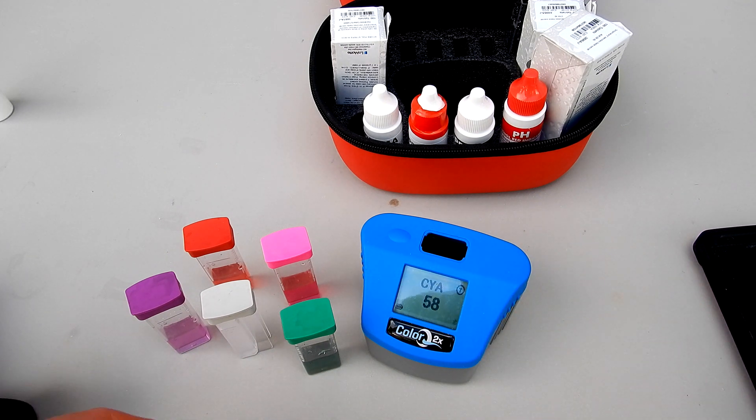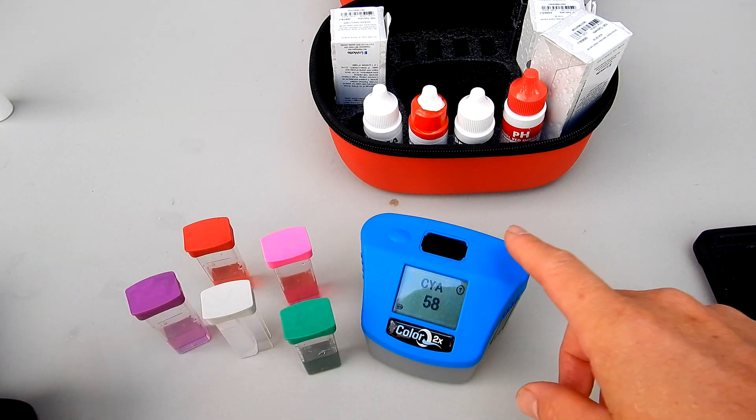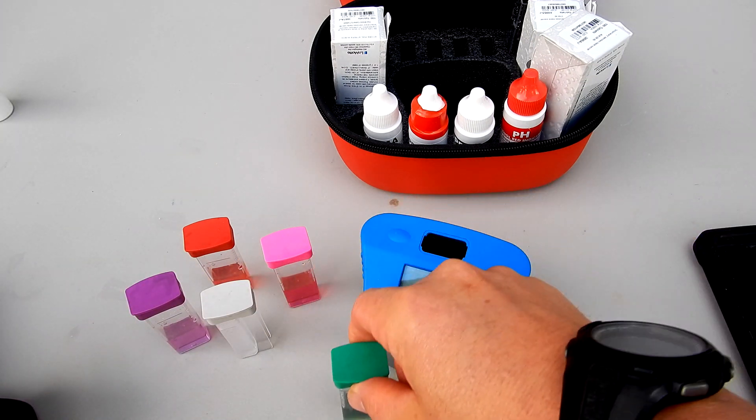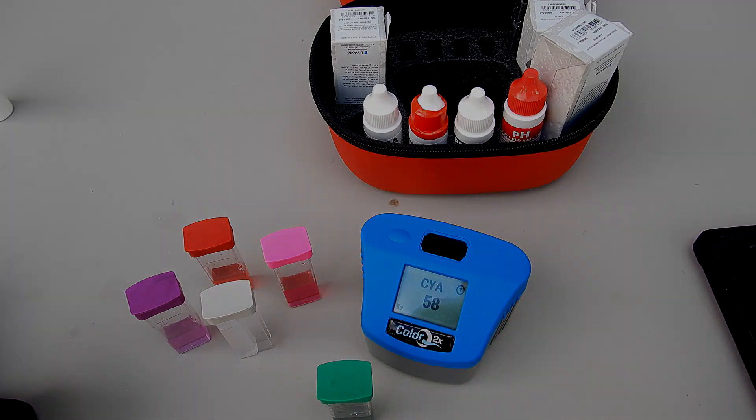It's pretty easy and it's pretty quick. I really like how fast this photometer reads the actual reagents that are in here. It gives you a really spot on reading quickly.